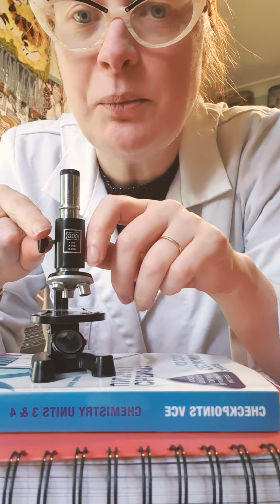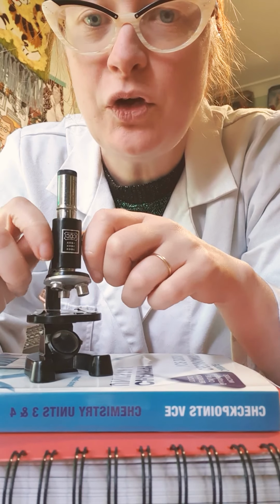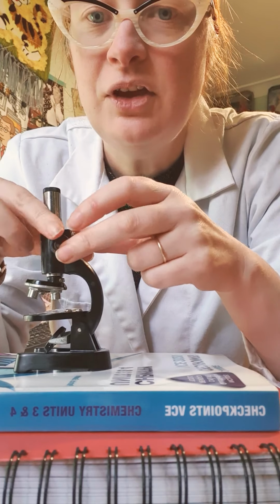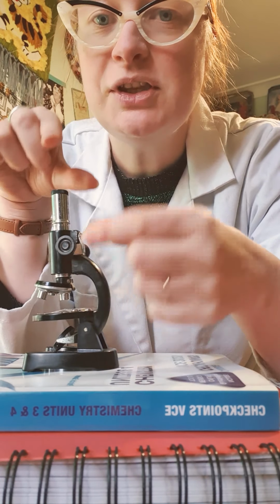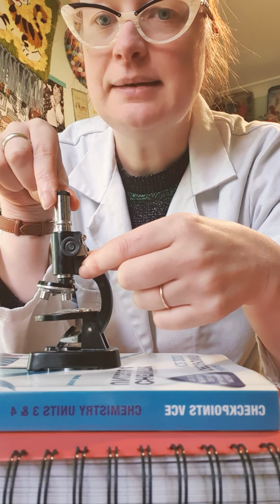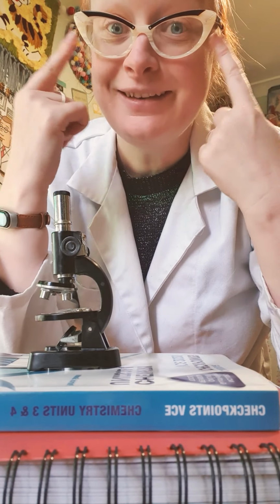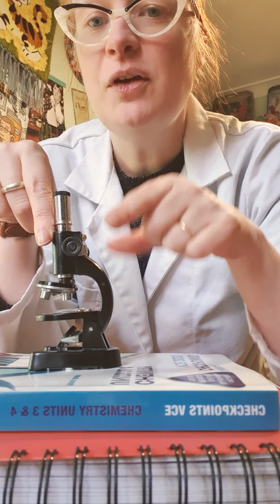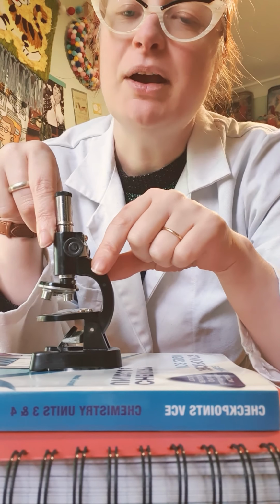It's a bit blurry. So what we can do is we use these. I've only got this one. You'll have two different ones. So you have one so you can focus it up and down, and then you've got a finer one which will just do those little tweaks. So when you've got it nearly there, you can just do the last little bits. When I help you out with doing the microscopes, because I have such bad eyesight, I take my glasses off because it makes it easier. And then I use this one to focus it, and I focus it from my eyes, and then you can just gently tweak it from there, because you generally have better eyes than I do.